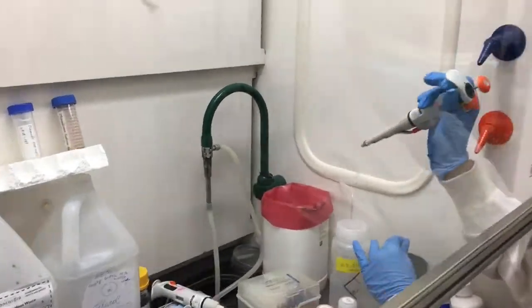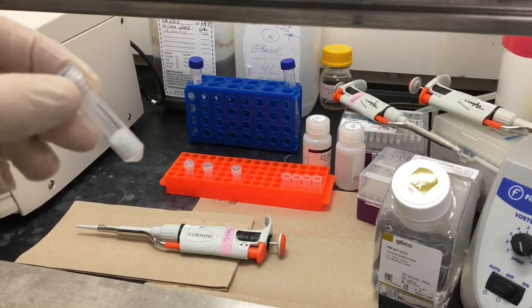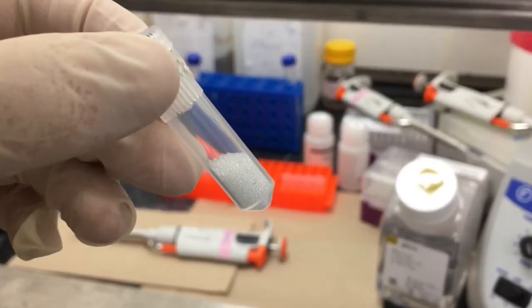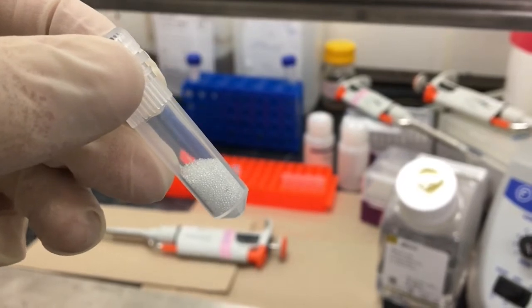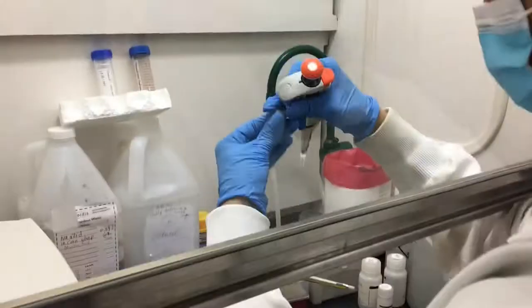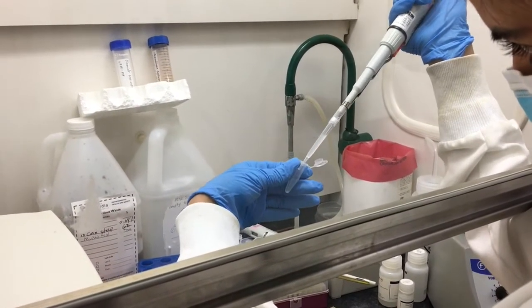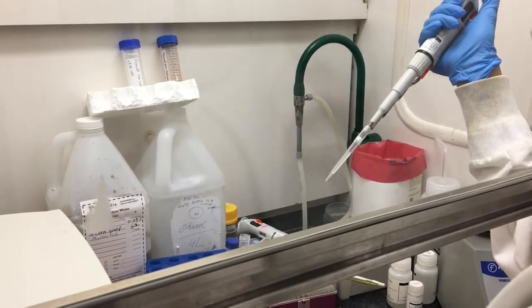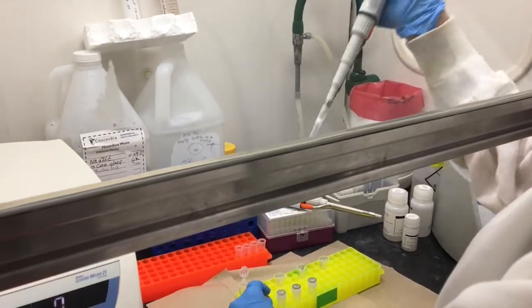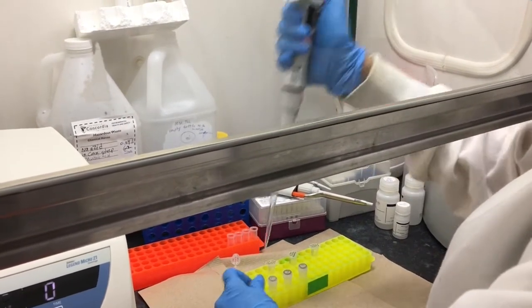Next, we need to break open the cells. Yeast have cell walls that differ in composition from those of E. coli, so we can't use the same enzymes to break them down. Instead, we will use glass beads to break open the cells with a bead mill. We add the cells suspended in RNA lysis buffer into tubes containing glass beads. We do this for the cells grown in glucose and those grown in galactose.